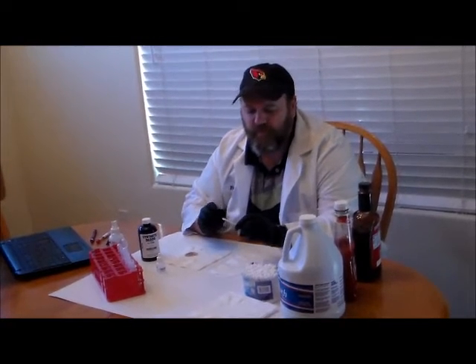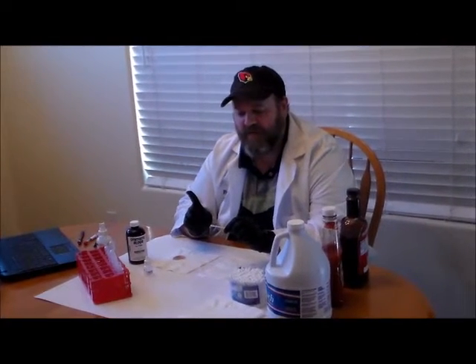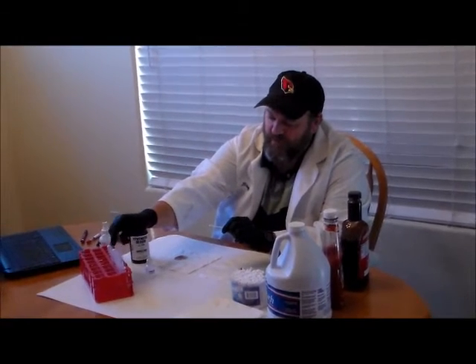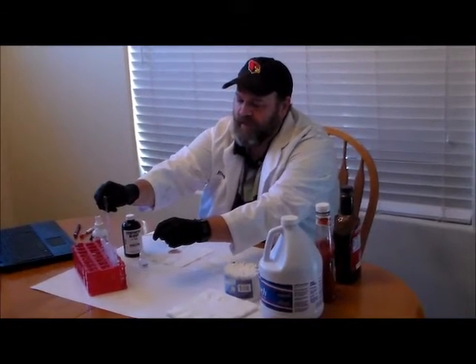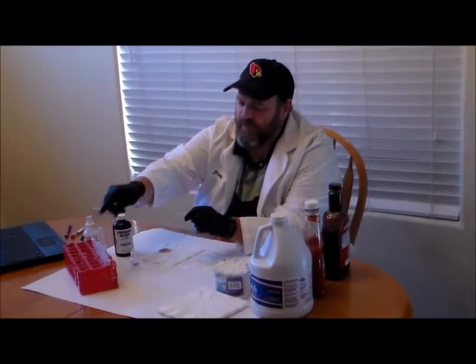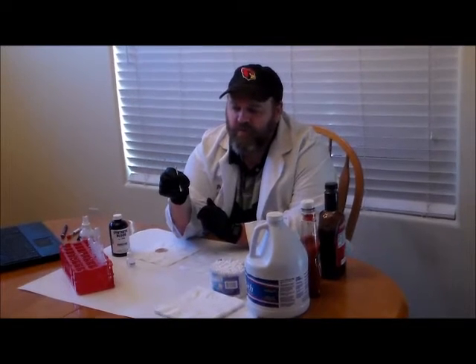Now I'm going to go ahead and add my chemicals. The leukomalachite test is a one-step test, meaning the only thing I need to add to the swab is the leukomalachite reagent. I'm going to use one of my transfer pipettes, suck a small amount of the reagent into my pipette, and then drop one or two drops on the end of my cotton swab. The stain turns kind of a dark green, almost bluish color, and that's a positive reaction for the presence of blood.